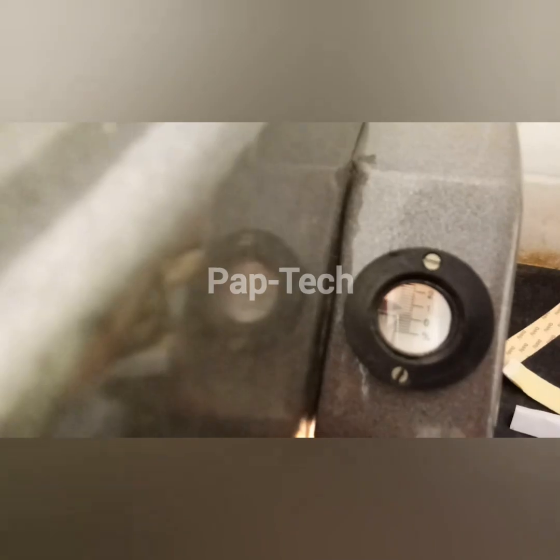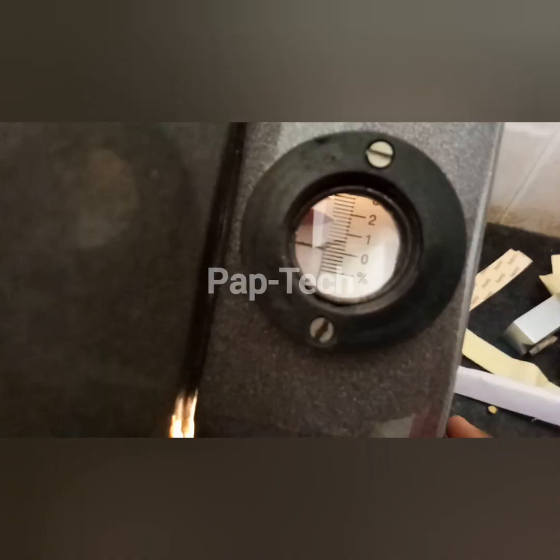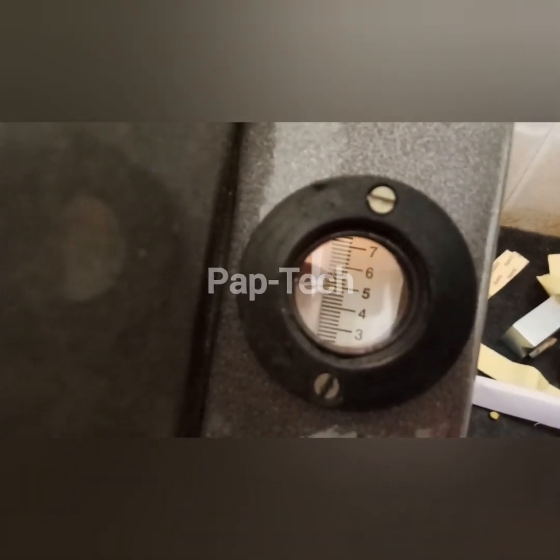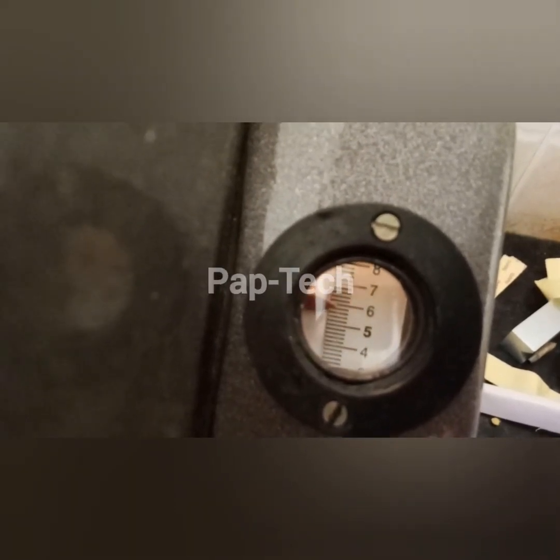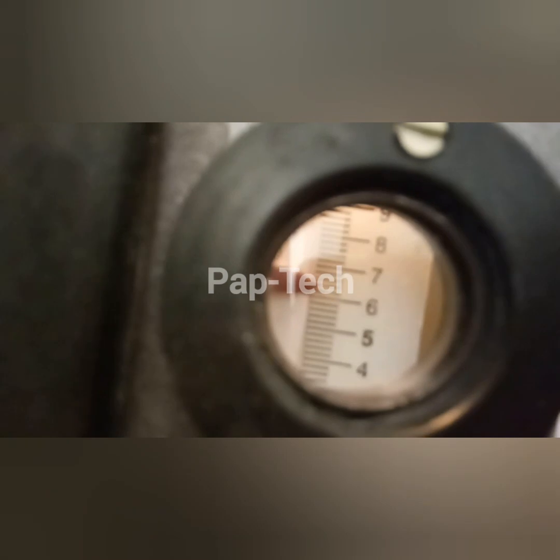The moisture content of the pulses will heat up in the meantime. We have to wait for eight to ten minutes to get an accurate reading. As you can see, the pulses are heating up. When we align the scale with the mark, we will get the moisture content percentage. It is showing six percent moisture after ten minutes.